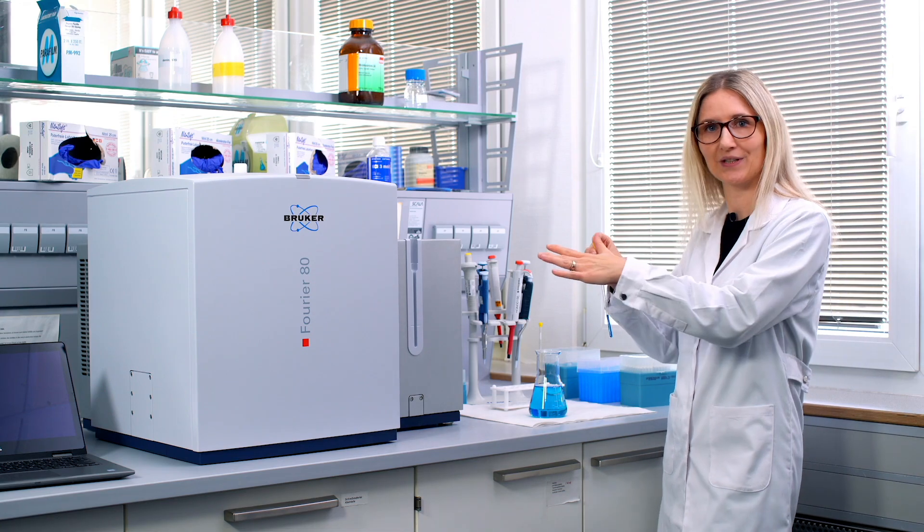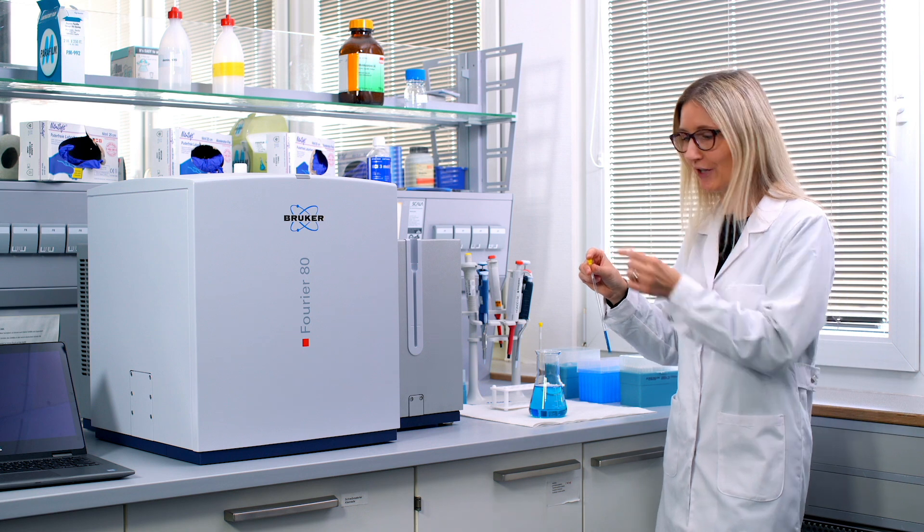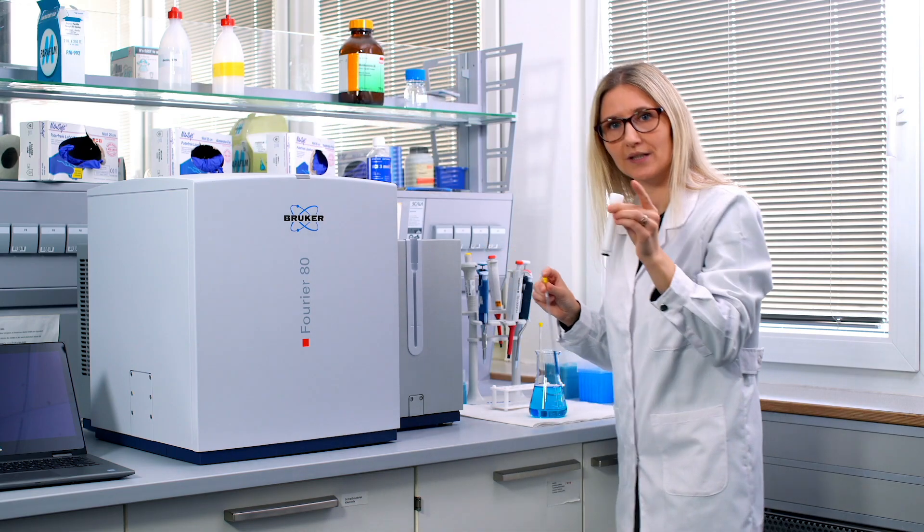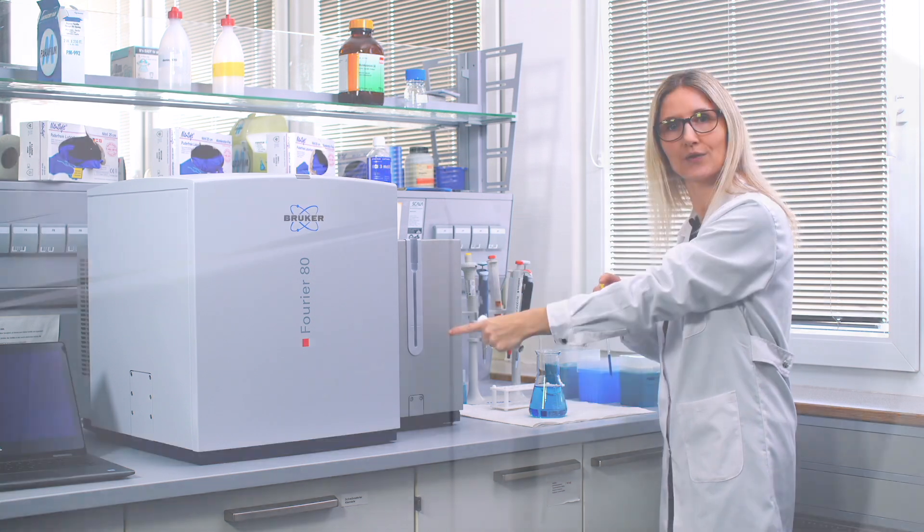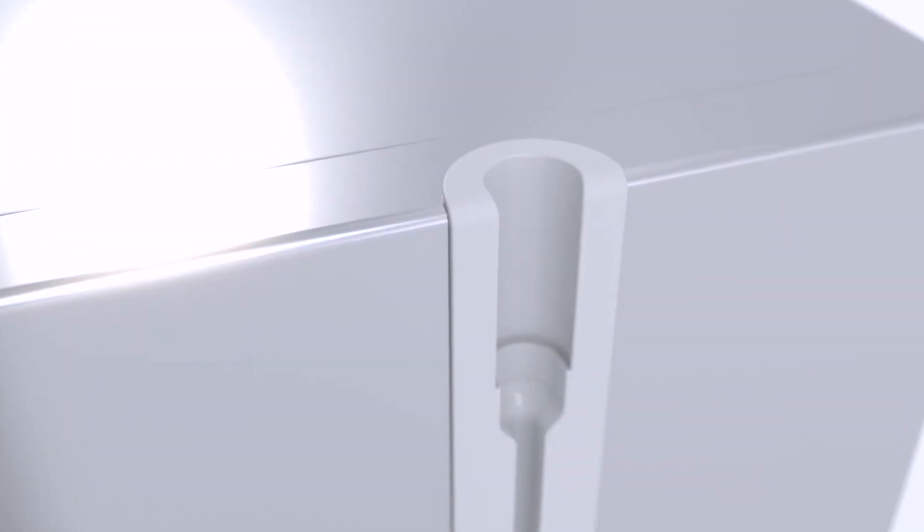But then, before inserting it into the system, you need to adjust the sample height. And therefore, you use our sample holder and you use the sample gauge which you can find on the right side of the spectrometer.